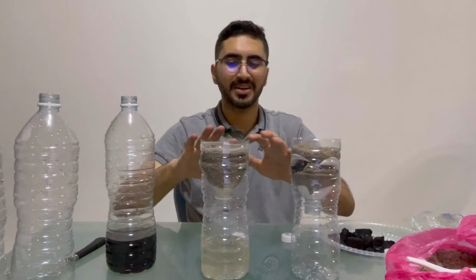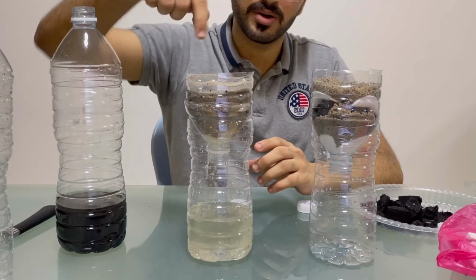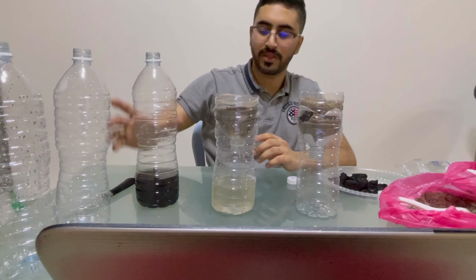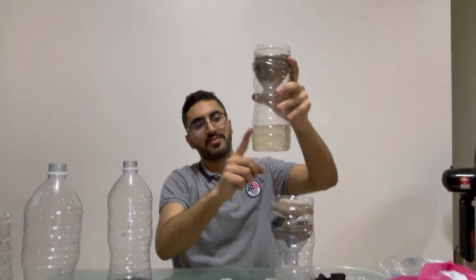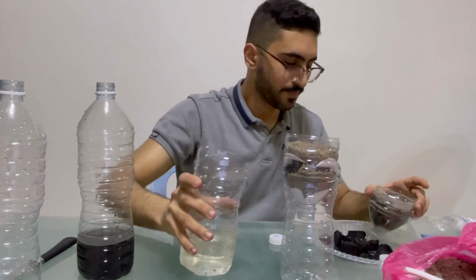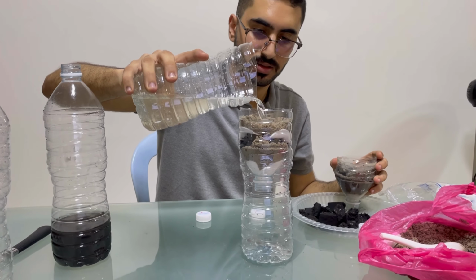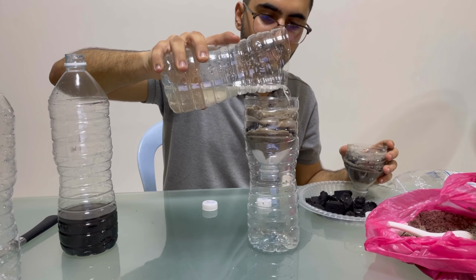So as you can see here, that's the water. It's hard for it to go out now because all the layers here contain the wastewater, the waste of the water. So this one, the first step, as you can see, it's so good. So then now we will put it for the second step for the water treatment. Here, same process, everything is the same.